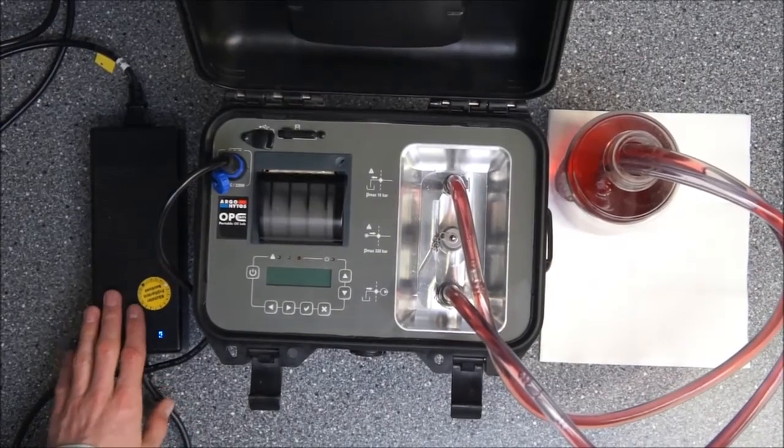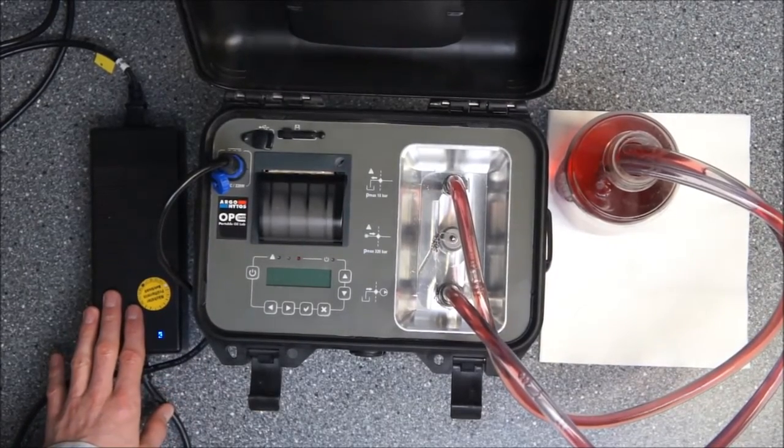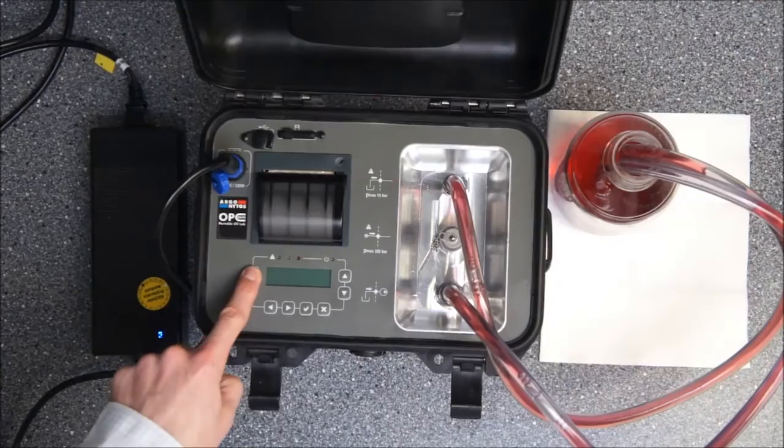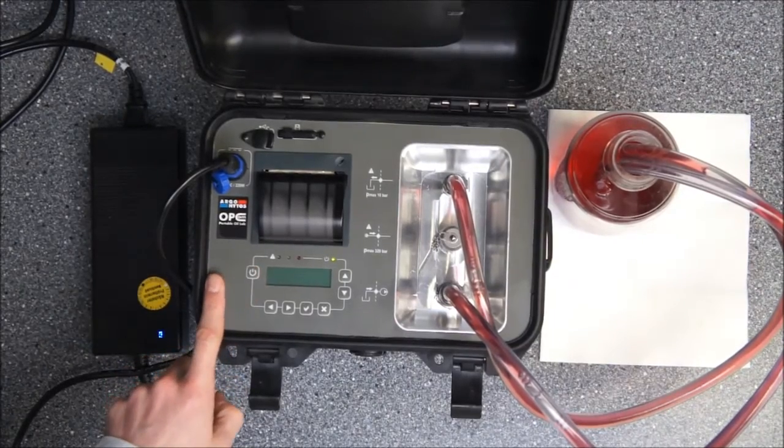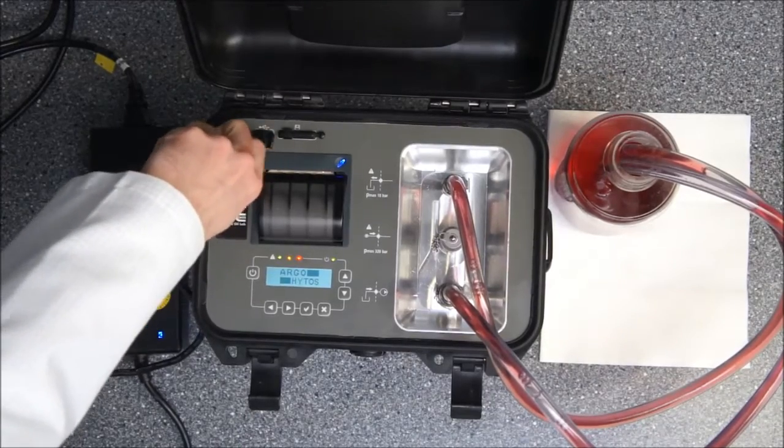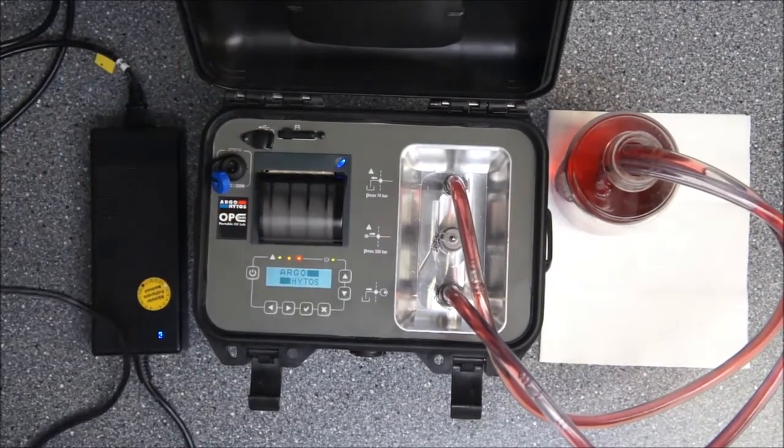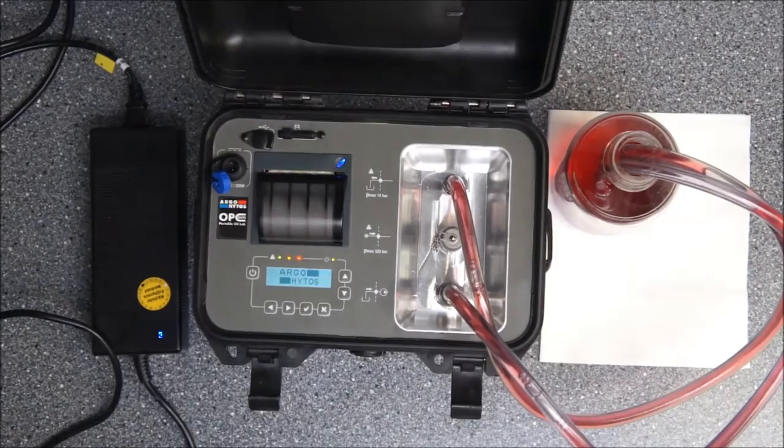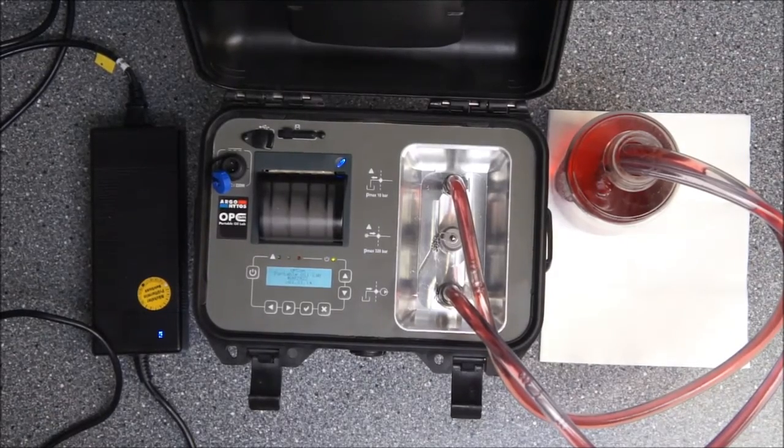The unit is charged up with an external power supply, and when I start it up you can see that the internal battery is sufficient to let the unit run for a long period of time. I want to show you operation when it is just powered by the battery.